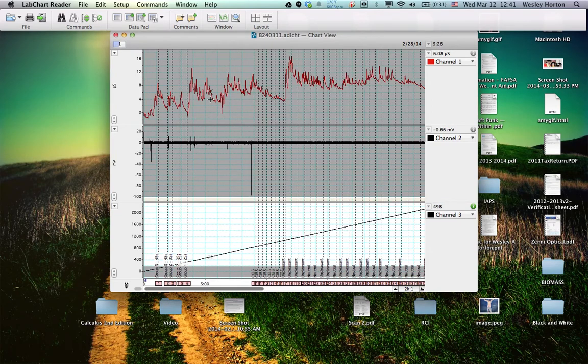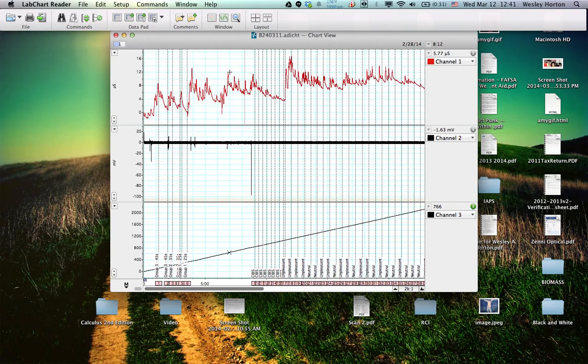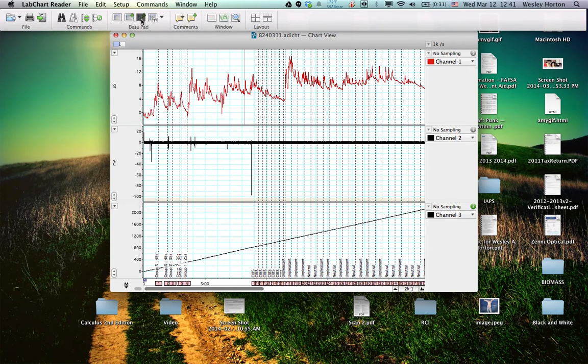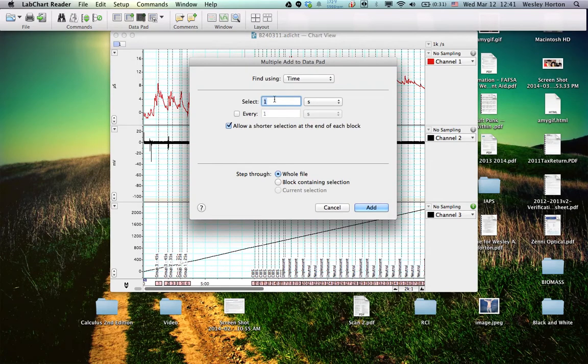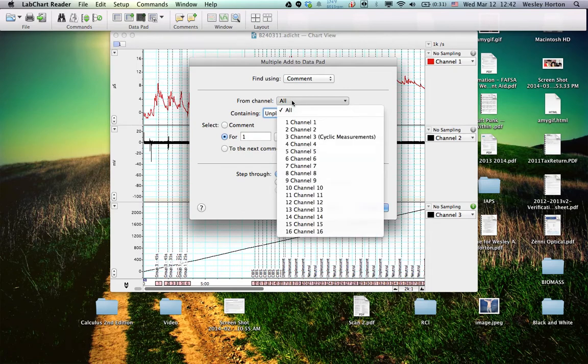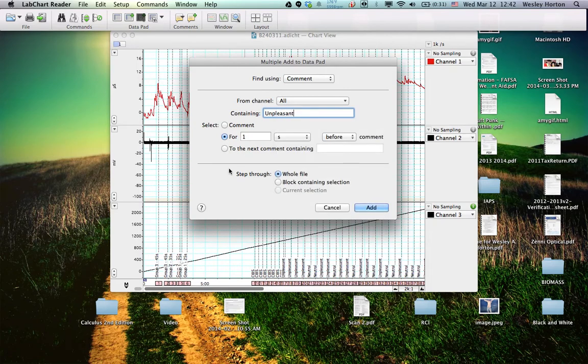Now we can go ahead and pull our data. Alright, so to pull our data, we're going to go to Command, Multiple Add to Data Pad, or you can actually just click Multiple Add to Data Pad right here. So we're going to select Comment, and let's pull our unpleasant first. And we're going to do 1 second before. We can select channel 1, it doesn't really matter because we'll be cleaning up the data later and the whole file.